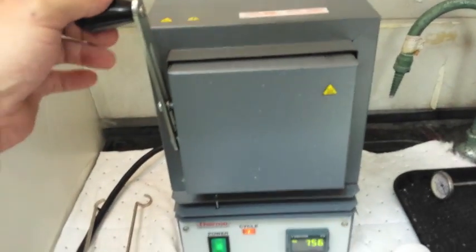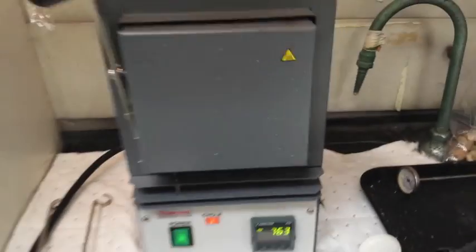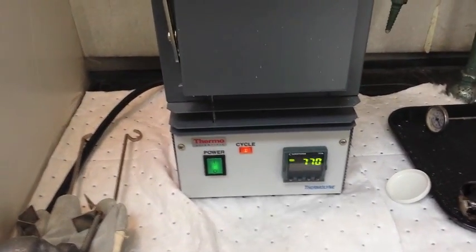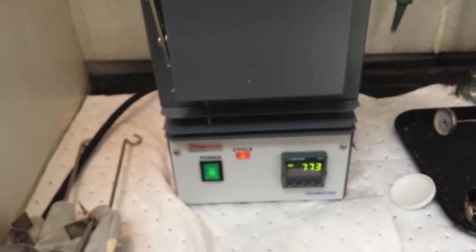And you can see the small black spots around the top of the crucible. This gold is currently at 760 degrees Celsius. When it hits 1100, the gold will melt. Hydrochloric acid boils away. And we'll have a bead of gold.